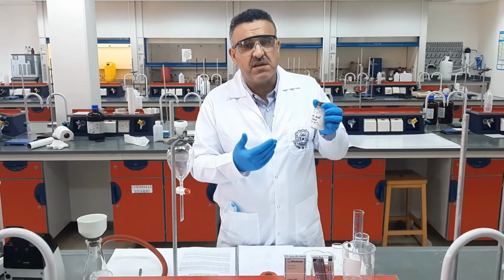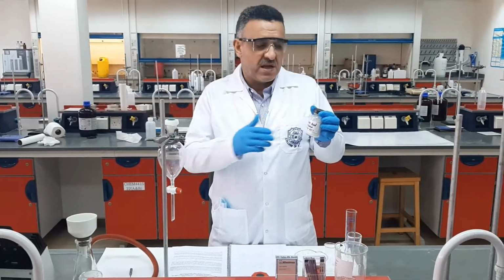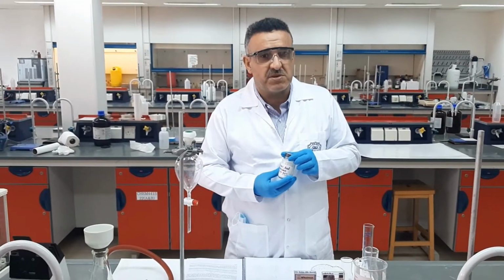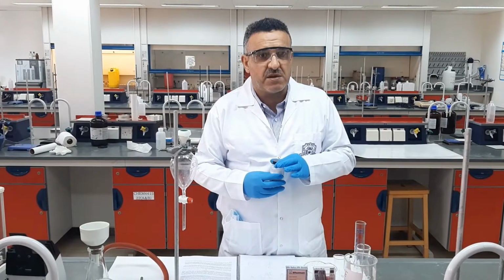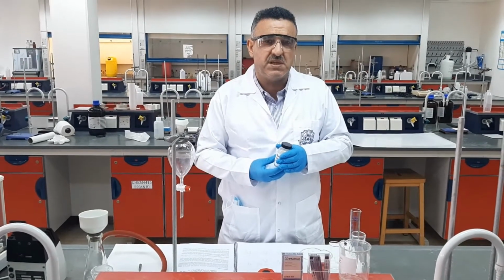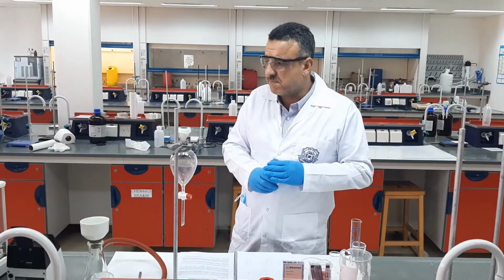In this case, when we add sodium hydroxide, as in the procedure, to the ethyl acetate, the acidic compound, the benzoic acid, will definitely be soluble in the sodium hydroxide solution, and thus it will be removed from the mixture, going to the aqueous solution. The naphthalene will never be soluble in water because of the general rule of solubility: like dissolves like. So naphthalene cannot be soluble in water. So let's proceed, and in every step we will explain further.